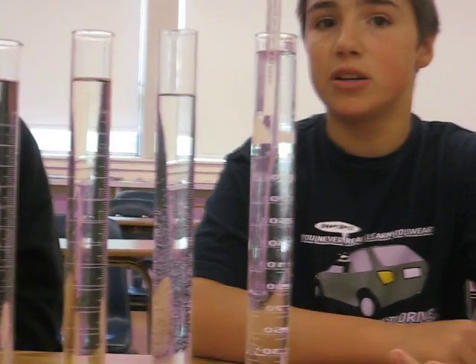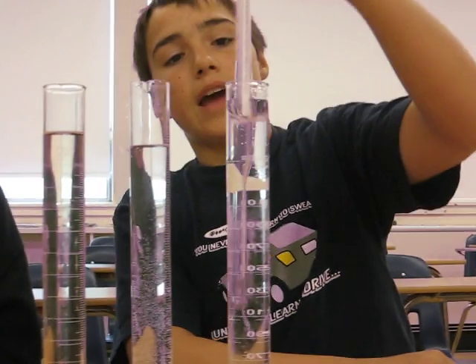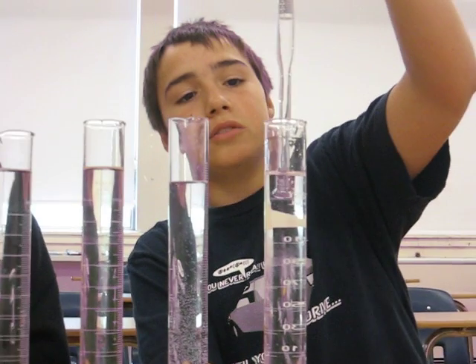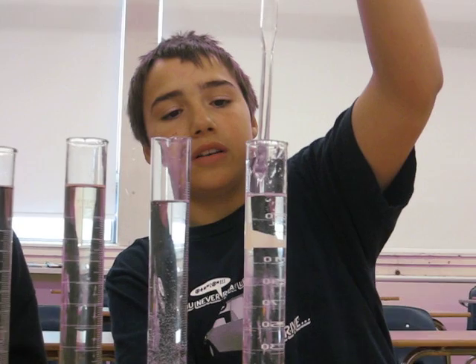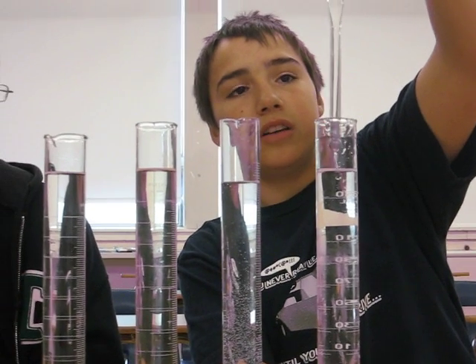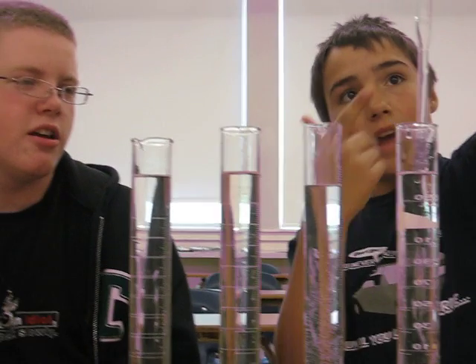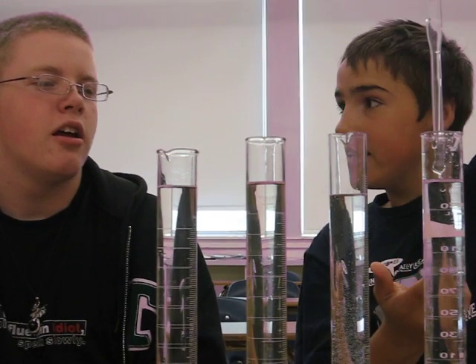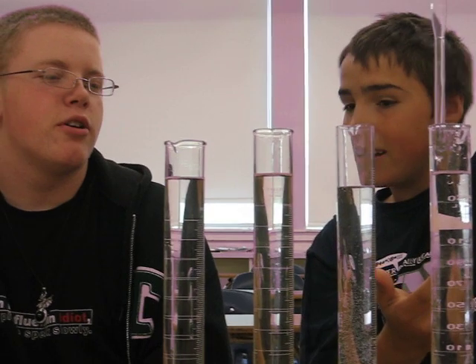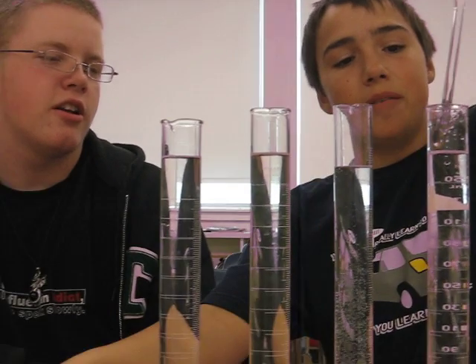It's interesting to see how much there is. And that concludes our presentation on density and the hydrometer. Thank you, and see ya. Later.